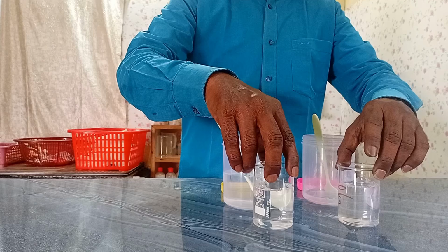I am getting a clear homogeneous medium. But the point is, I have used 20 grams paste in 100 ml water in the first one. Suppose if I use excess paste, 25 grams or 30 grams, maybe slight turbidity is possible. Something like chances of missing clarity or transparency is possible.